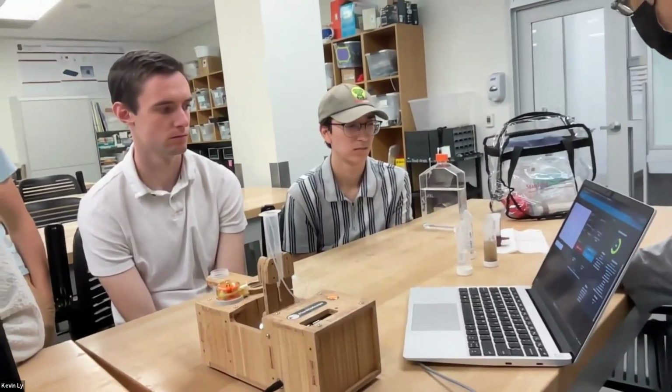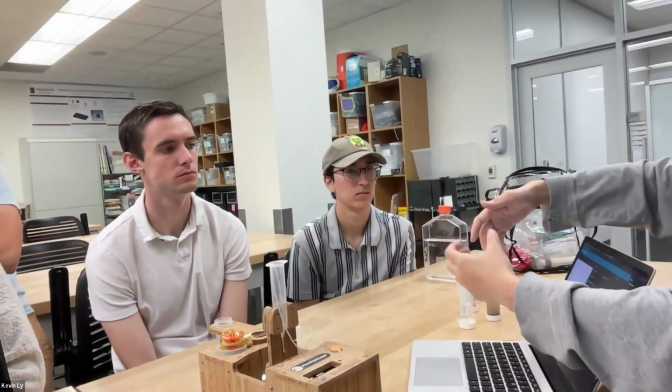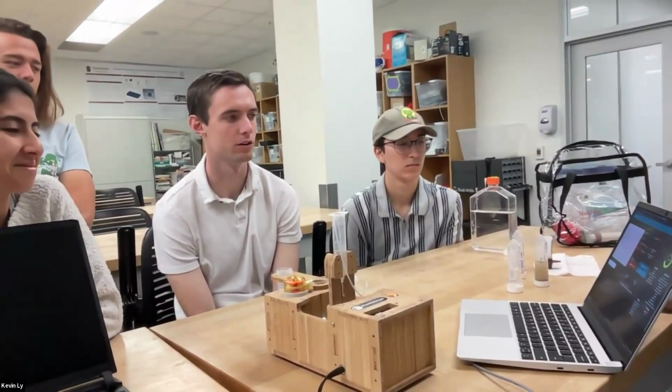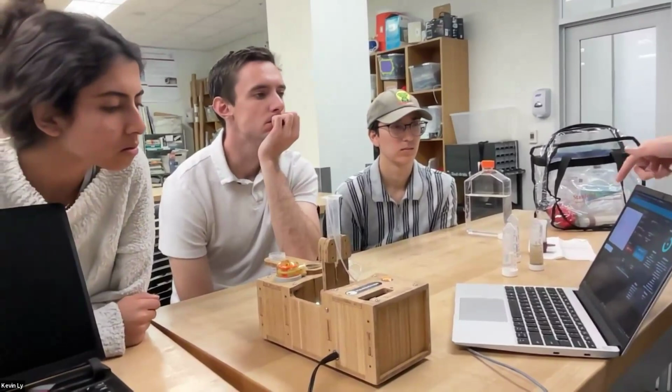So what they do with seawater samples is usually have this giant net with a very fine mesh, and then there's a bottle at the bottom. They basically filter water like a whale to catch all the plankton. Cool. Those are plankton nets. That's a way of concentrating the samples so that we don't just see empty stuff most of the time.